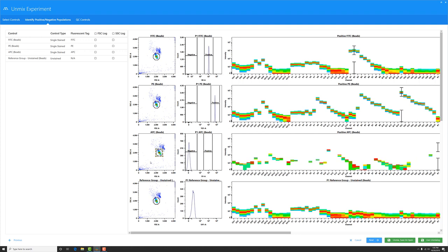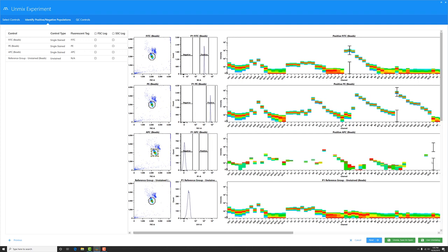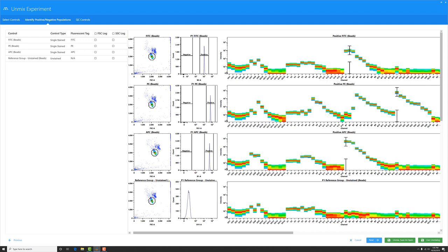And you can see already for this APC control, the software placed my gate on the R1 channel, which is where APC should peak, but there's no signal in this particular tube. I'm going to go ahead and move the bars here to a different plot. So I'll have a different plot displaying on this histogram. And I can see this dye actually has a lot of signal in B1, B2, B3. It doesn't really look like APC.